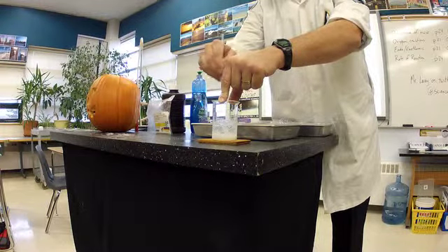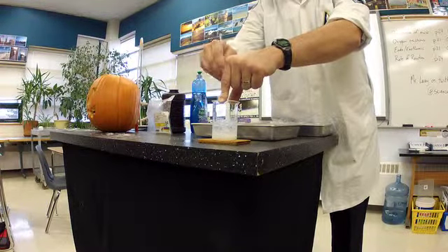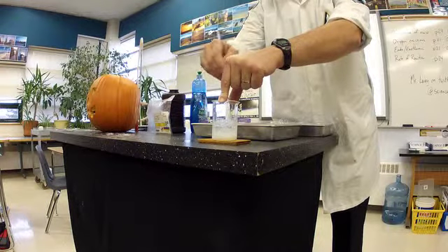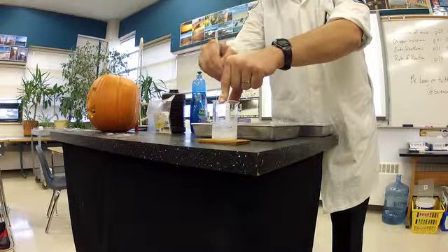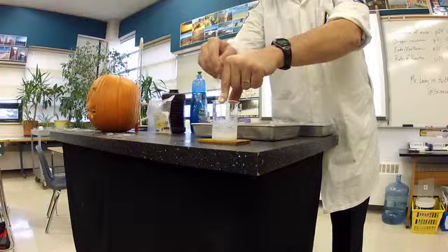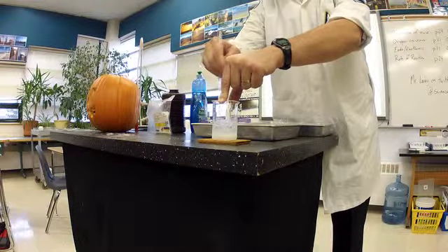So this is reacting and as I told you it's endothermic so it is using the energy around it to react and because of that will it feel hot or cold? Cold.